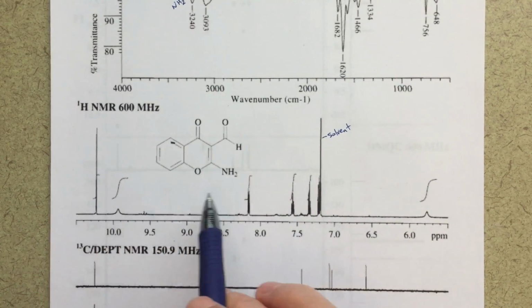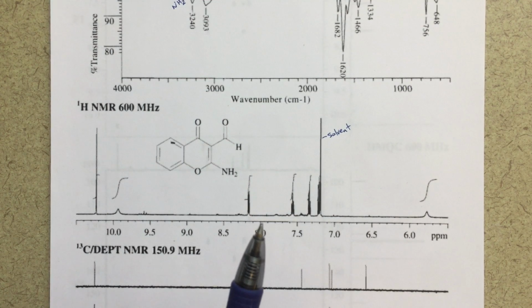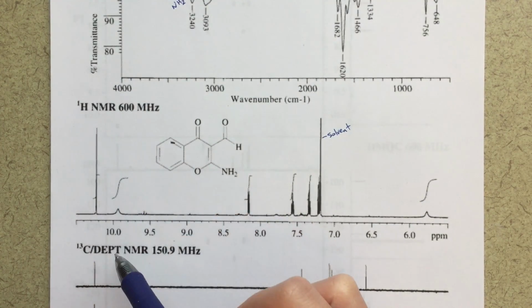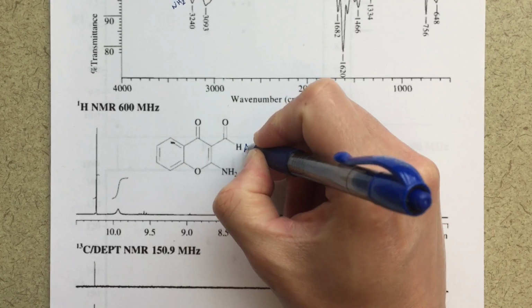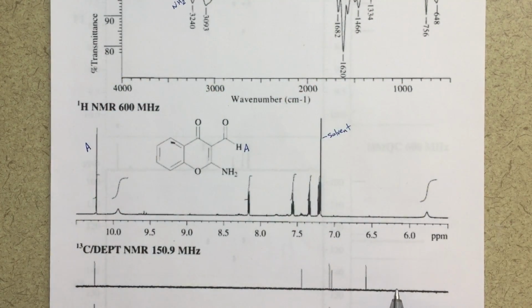First thing I'm going to do is look at this proton NMR, get oriented, and maybe do a few assignments if we see something that's very obvious. And the first thing I'm going to notice is I've got this aldehyde peak here. So out here, a sharp peak at just past 10. I think pretty clearly that's going to be this aldehyde peak. I'm going to label this as an HA, so I can label that as my aldehyde peak right away.